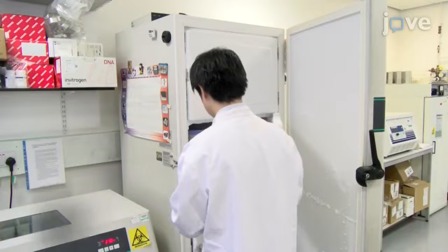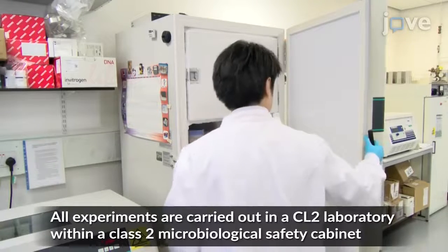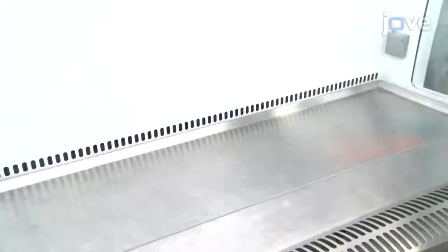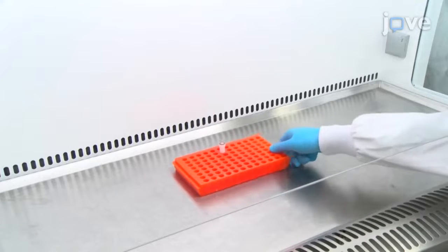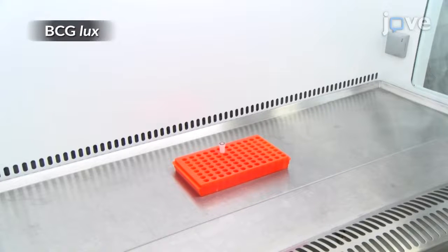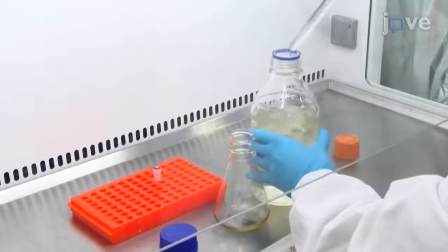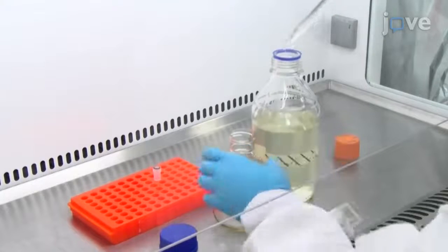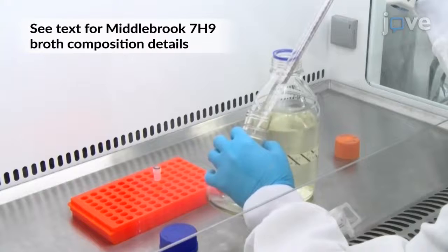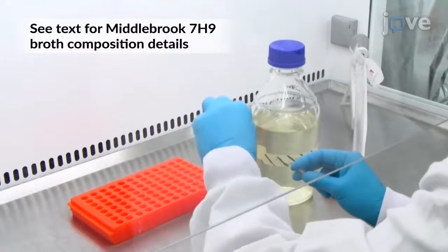To begin, defrost a frozen 1.2-milliliter glycerol stock of Mycobacterium bovis BCG-LUX, the Montreal vaccine strain transformed with the shuttle plasmid PSMT1 carrying the LUX-AB genes. In a labelled 250-milliliter Erlenmeyer flask, inoculate 15 milliliters of Middlebrook 7H9 broth with the defrosted 1.2-milliliter aliquot of BCG-LUX.